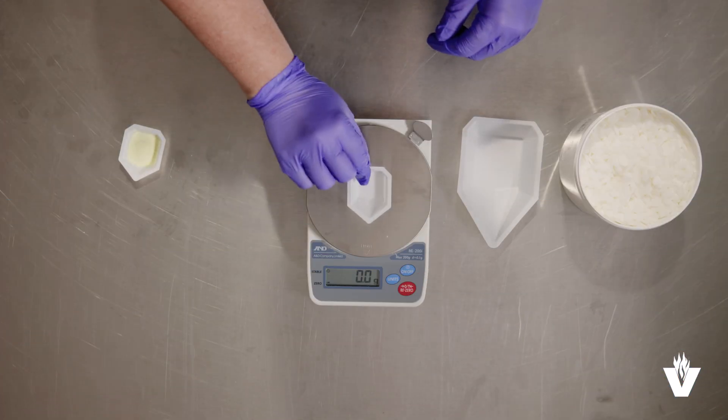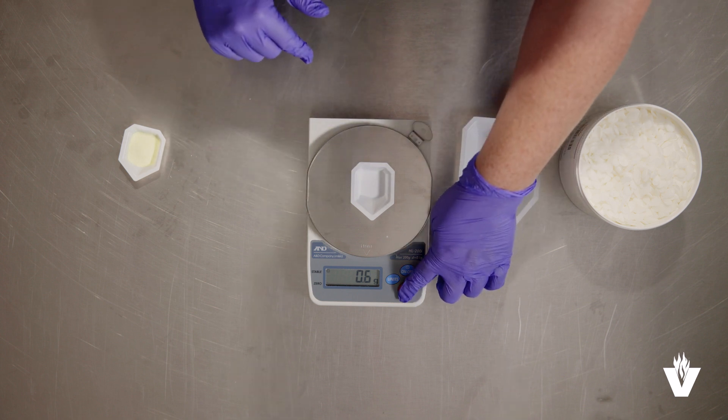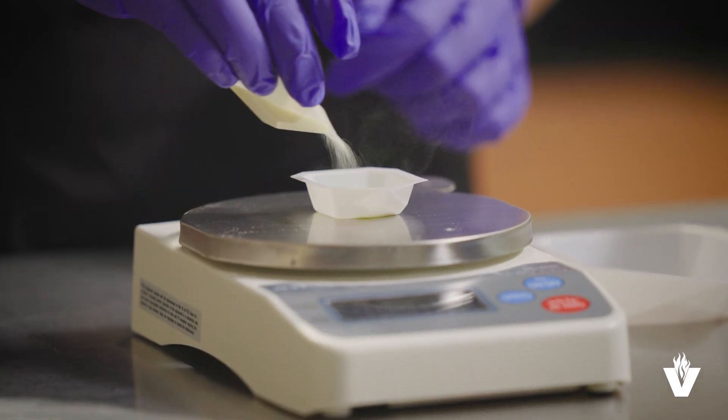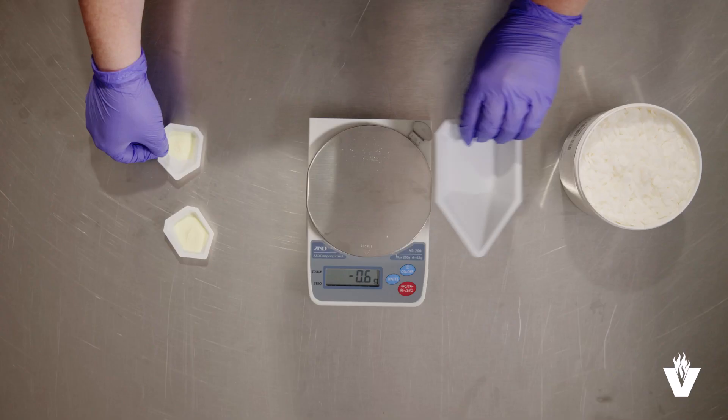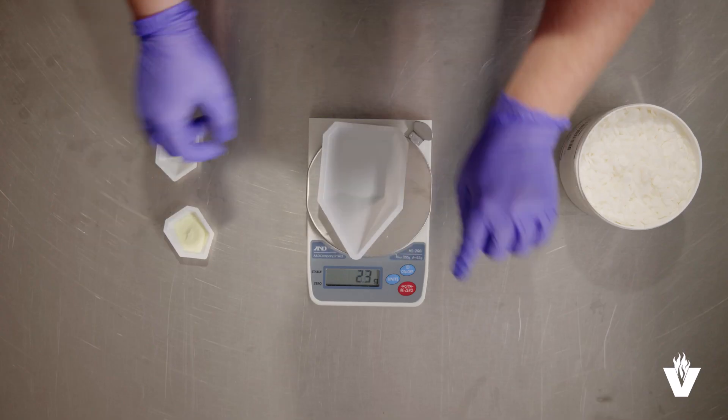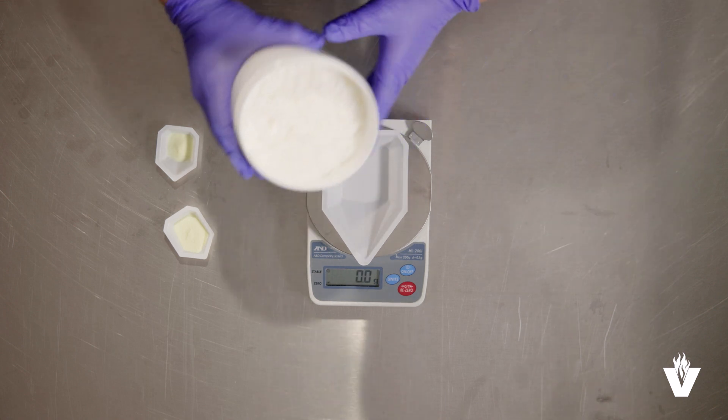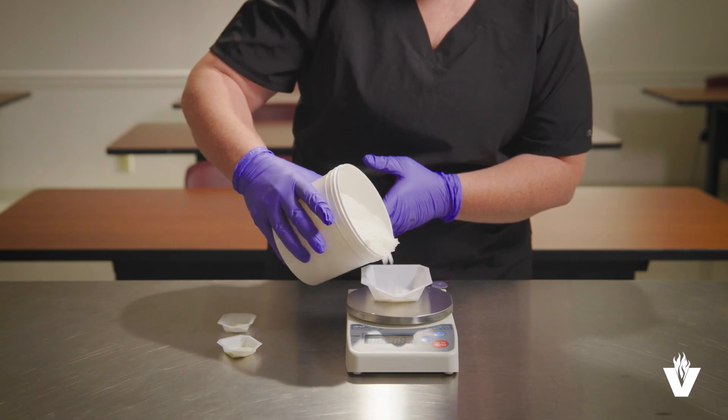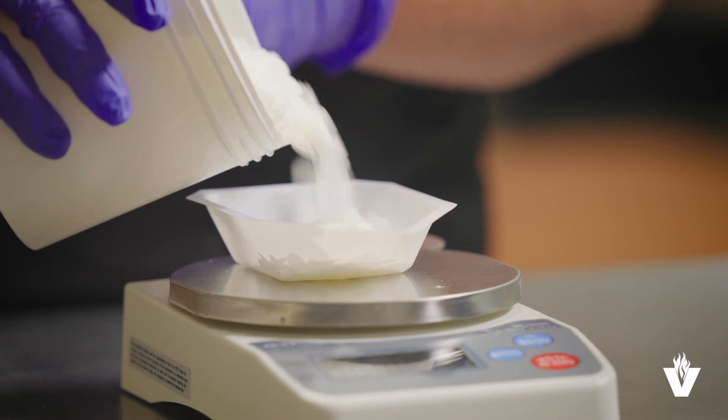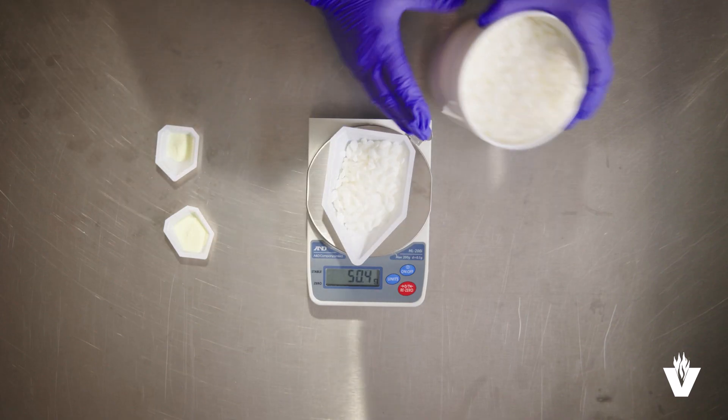Make sure to place the empty weigh boat on the scale and zero it out. Then weigh the powder. Do the same process for the base ingredient. As a technician, you need to have your pharmacist on site verify the weight amounts of your products.